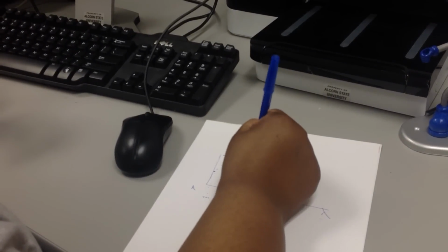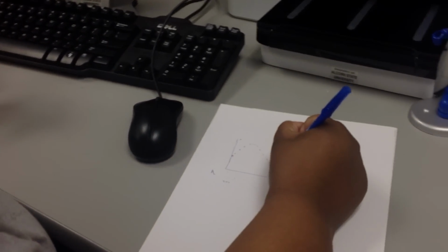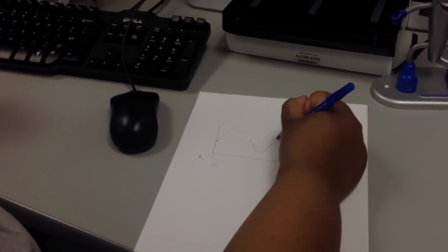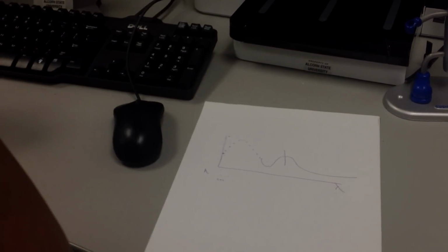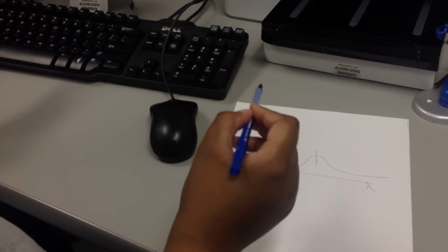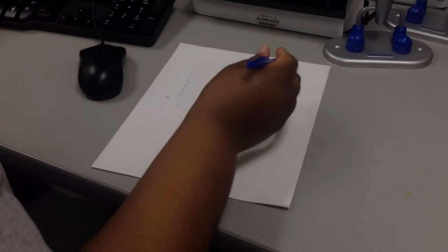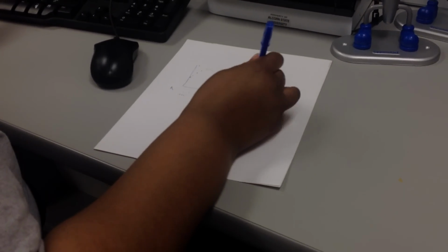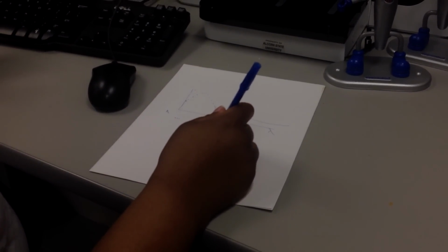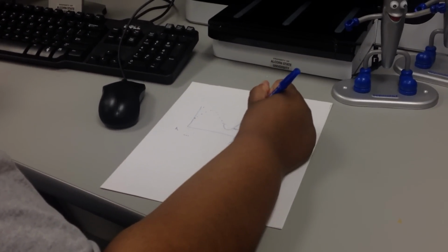But eventually, you're going to get a plot of the amount of absorbance at every wavelength, and that's what we call an absorbance spectrum. So basically, that's going to tell you what color, because that corresponds to the wavelength of light. That's going to tell you what color your particles are. And because of gold nanoparticles, this peak down here around 520 nanometers or so, depending on how wide that peak is, it's going to tell you how monodispersed or how widely varied your particle sizes are. And it's also going to tell you how concentrated.